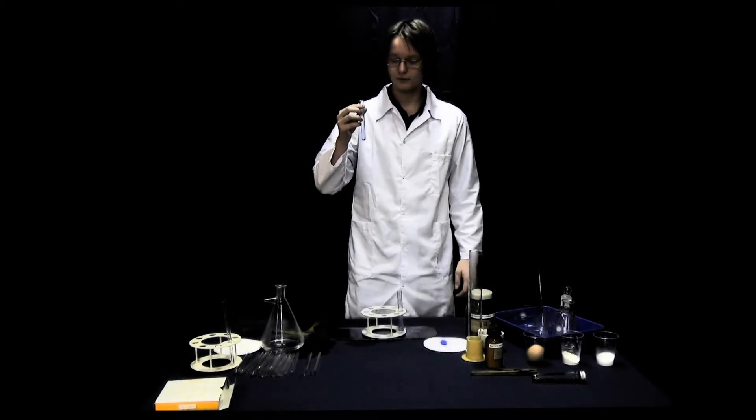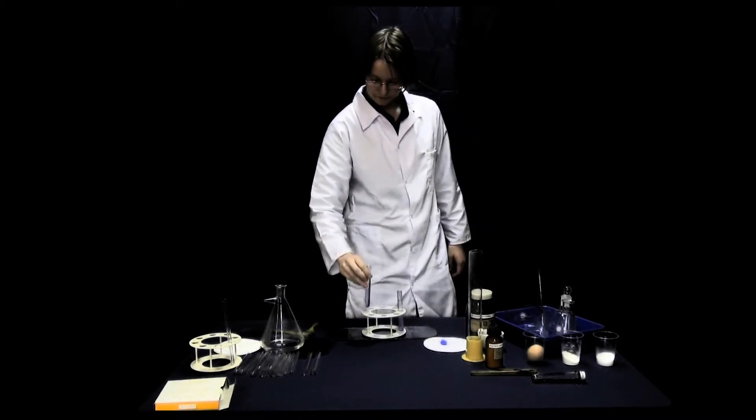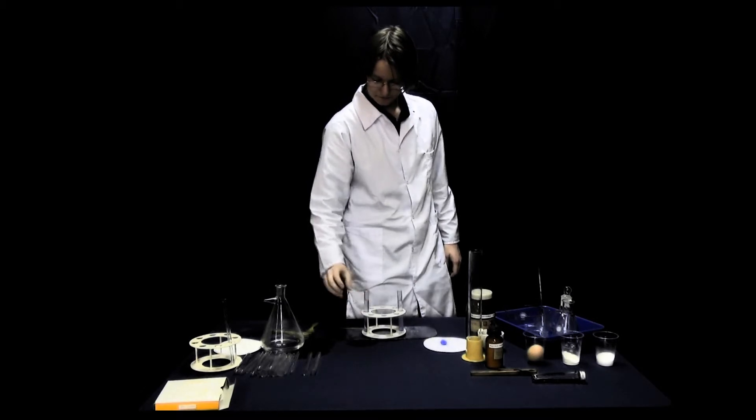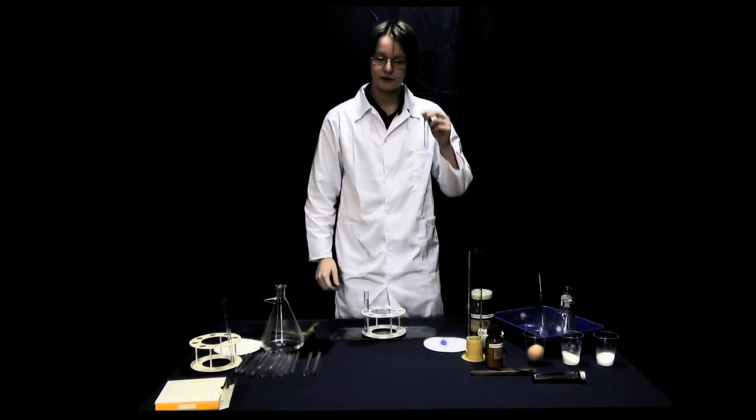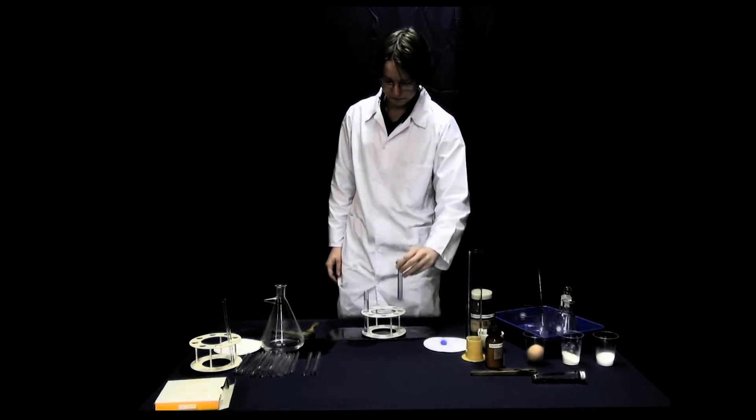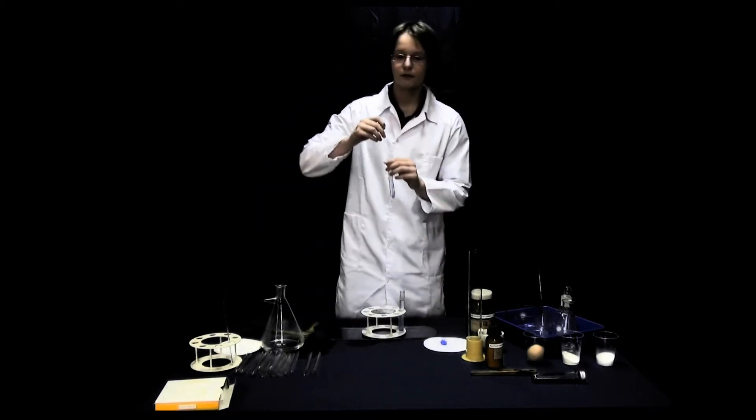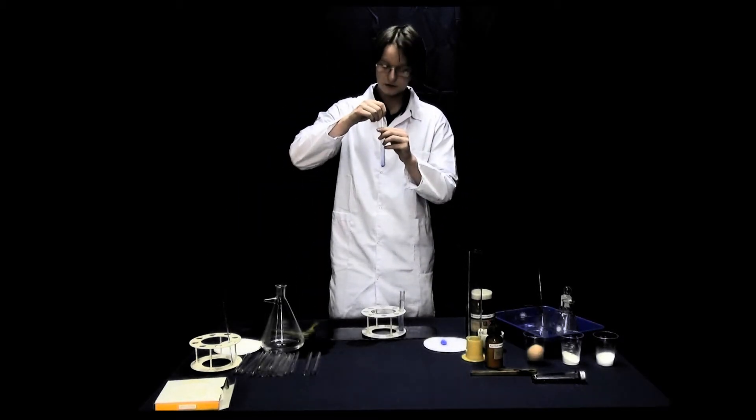There is water in a tube. At the bottom there is powdered copper sulphate. There is water in a tube. At the bottom there is powdered copper sulphate. I am mixing the content of the tube.